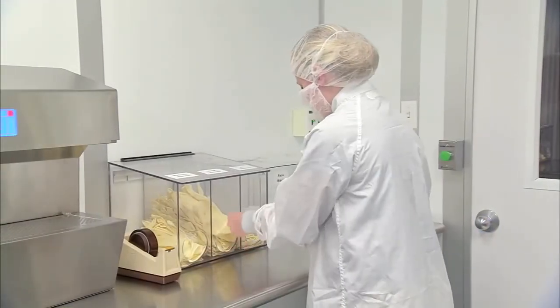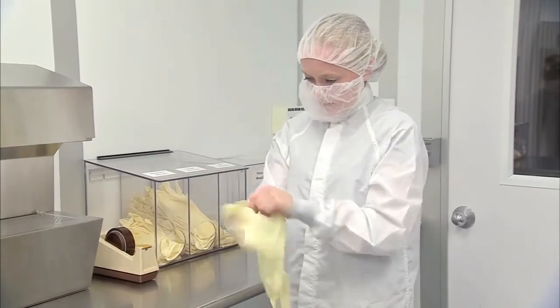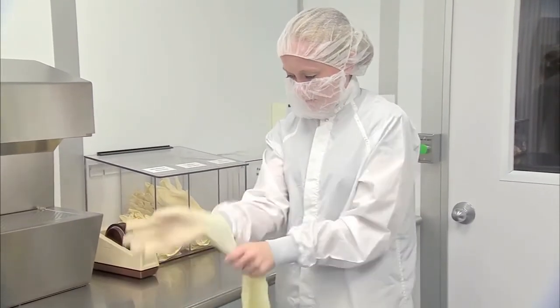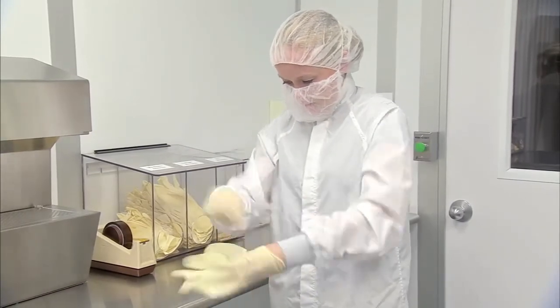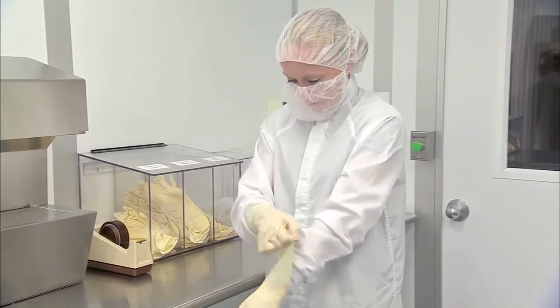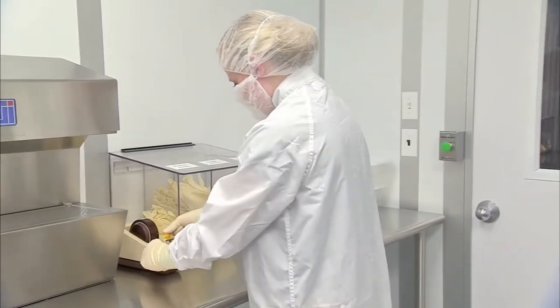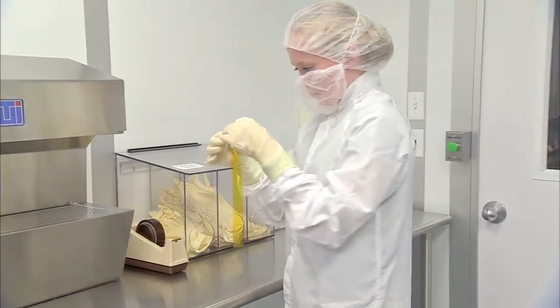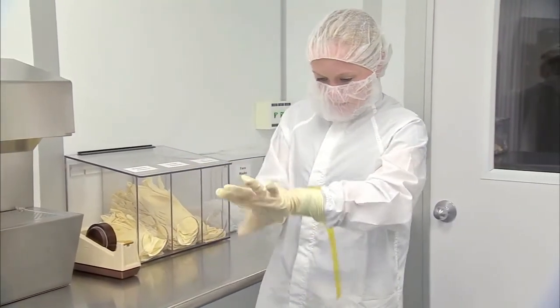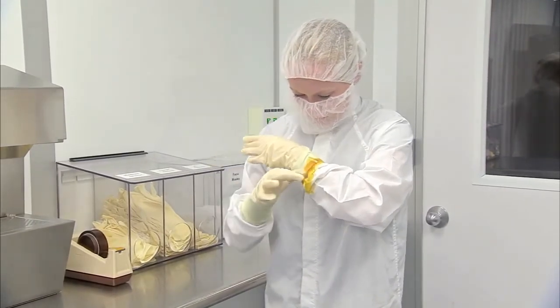Finally, obtain clean gloves. The specific type of glove approved for your area depends on the hardware and operations you will be performing. Always handle gloves by the gauntlet, and do not touch the finger and palm portion of the glove. Pull the gloves on and make sure the gauntlet of the glove covers the wrist of your smock. Some areas require additional control and require taping the glove gauntlet to the smock with approved tape. Again, check with your contamination control engineer or manager for this requirement.